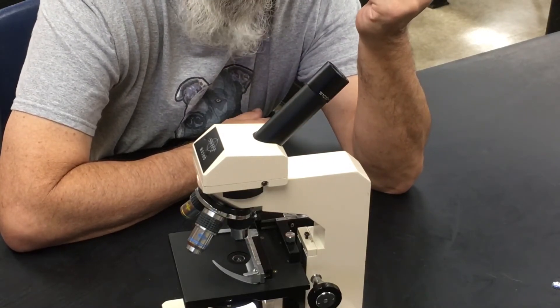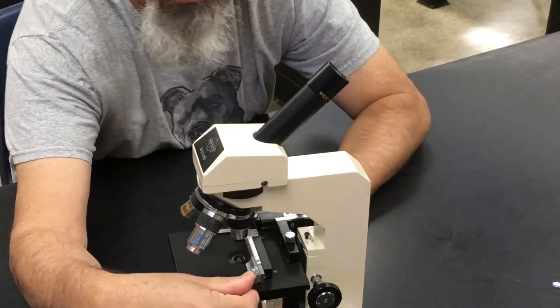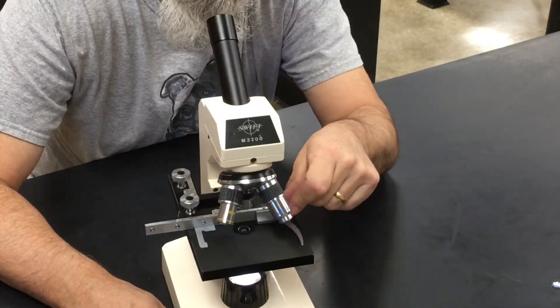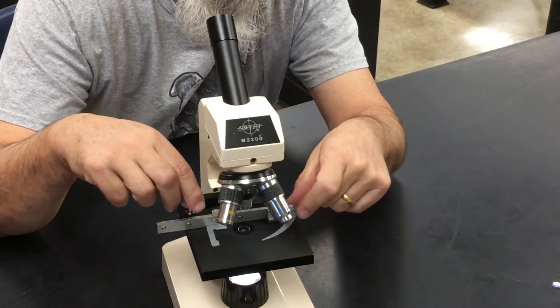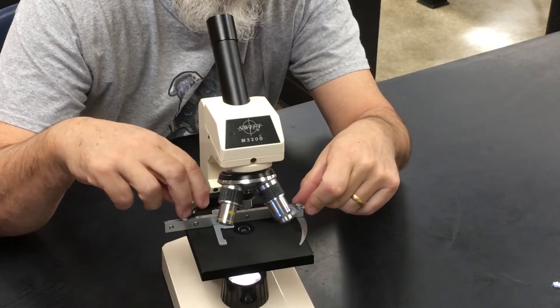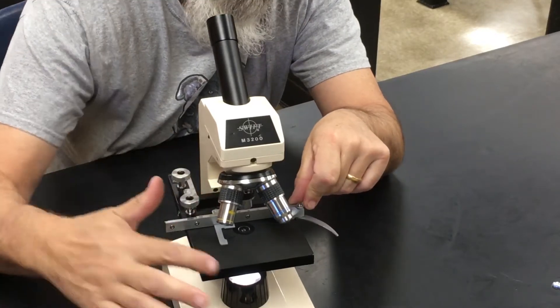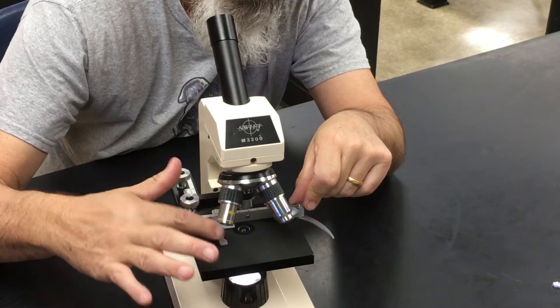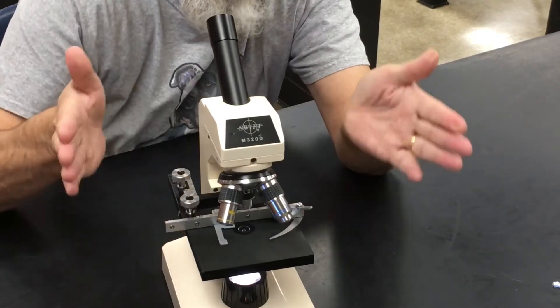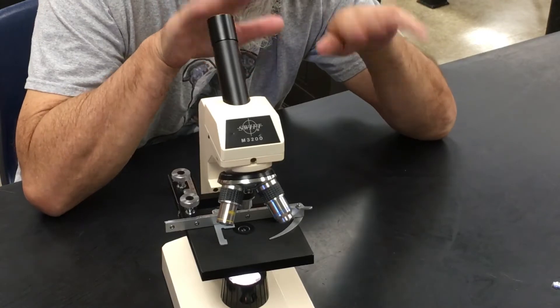The stage is where your slide and specimen are going to sit. When you turn this, you can see the platform — the part that holds your slide in place. You pull this back, set your slide in against this little corner, then ease it until it touches the slide and the tension holds it in there. Some of you may have learned on microscopes with little steel spring clips on top where you'd move the slide with your thumbs.